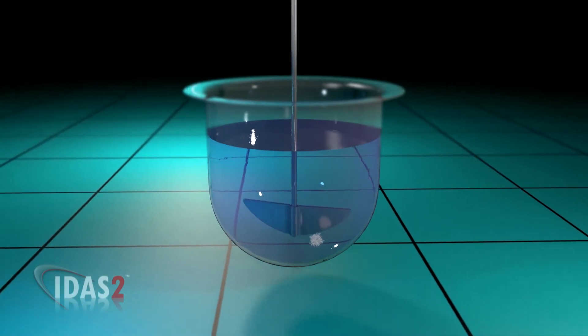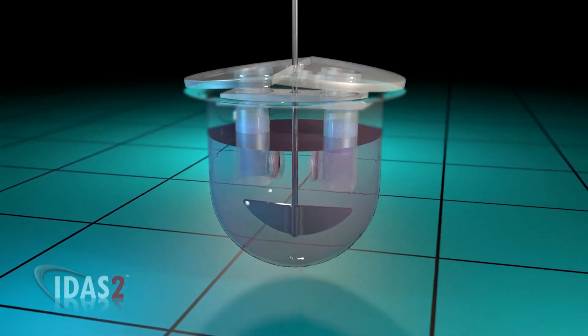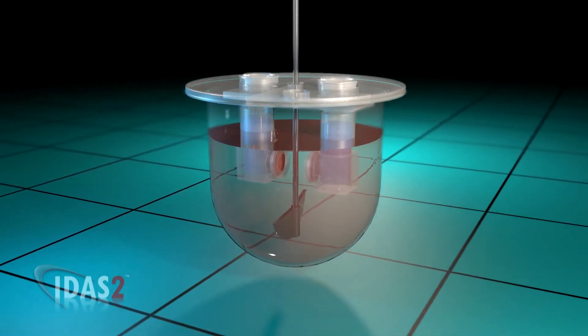The finished dose form can be added to the vessel prior to lowering in the IDAS2 or after the IDAS2 units are lowered into place.